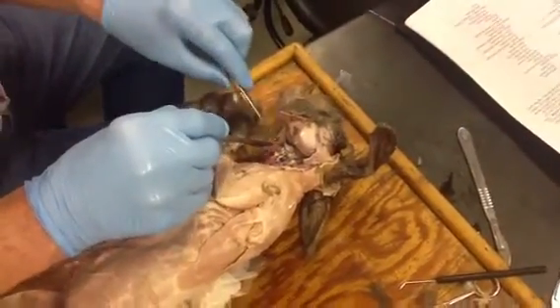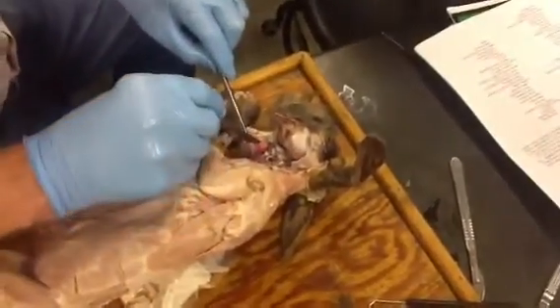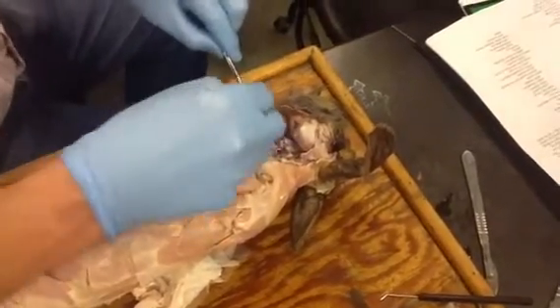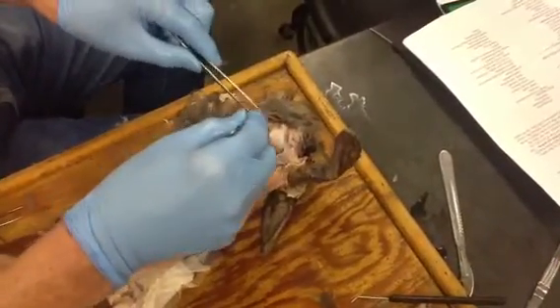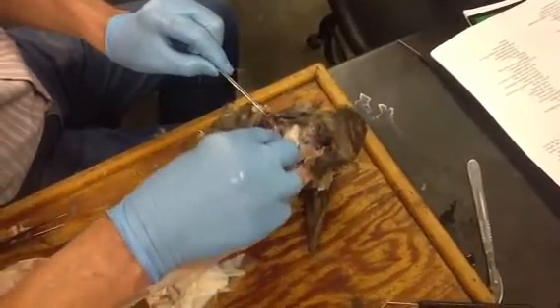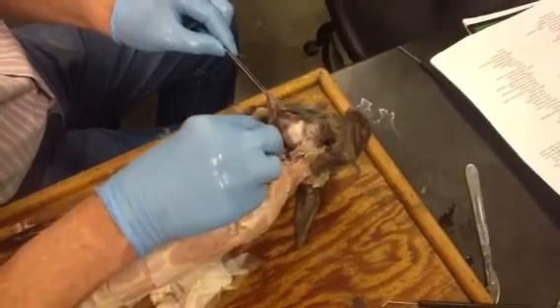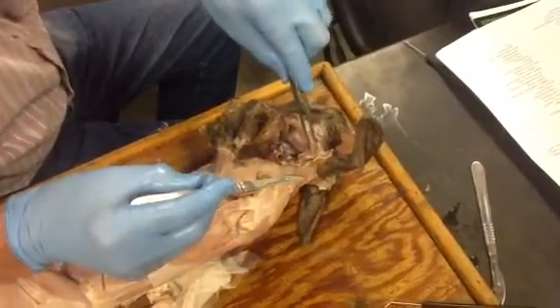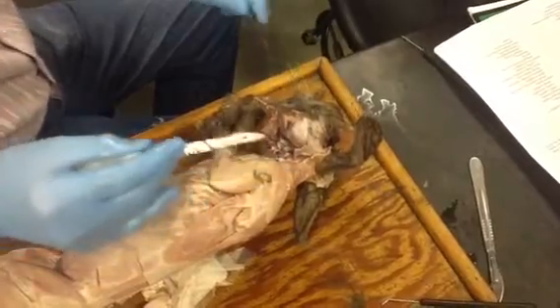So I'm going to take off that gland. What is a parotid gland? The carotid artery is the artery that supplies blood to the brain — internal carotid. But what about with a P — parotid gland? Oh, parotid. That's the large salivary gland right here, right in front of the ear. It looks like some of it might have gotten a little bit removed there.